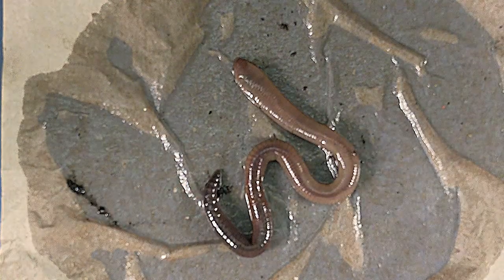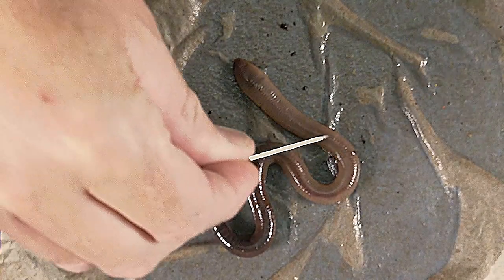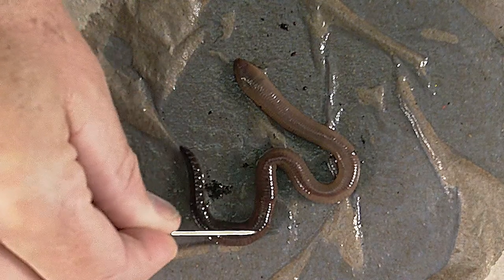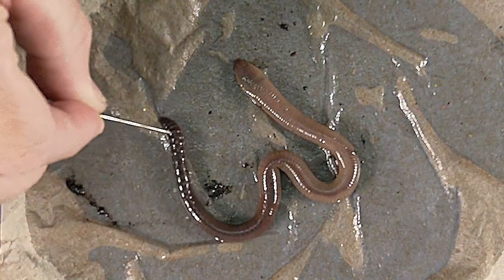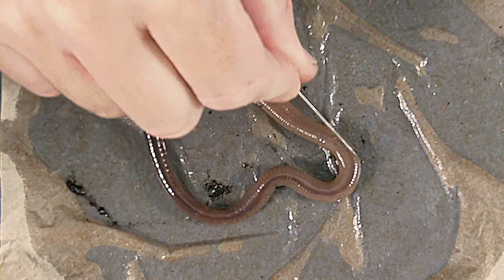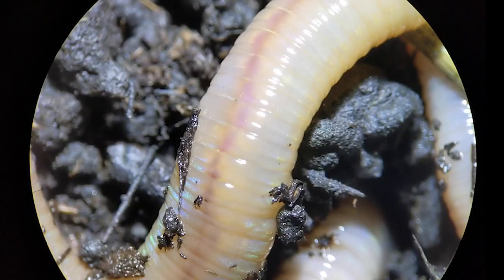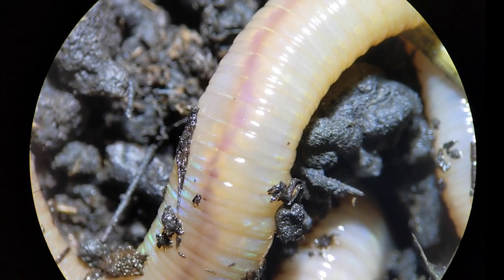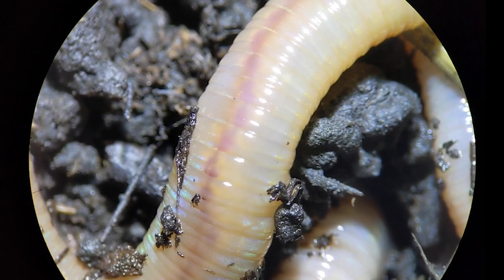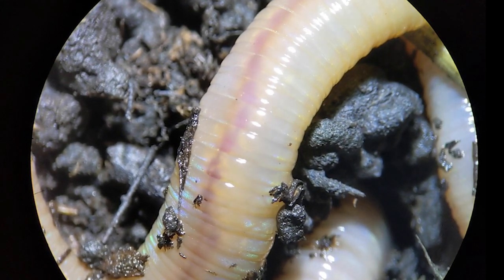You might be able to see a red line running along the animal on its dorsal surface — that would be its dorsal blood vessel, and we'll see that more clearly during the dissection. That dark line, which is a bit more obvious here, is the dorsal blood vessel. Through the body wall, you can actually see blood moving through it in little pulses, very slowly — slowly because the animal is cold.